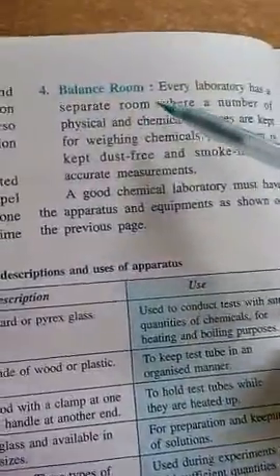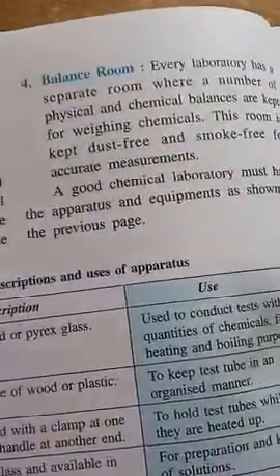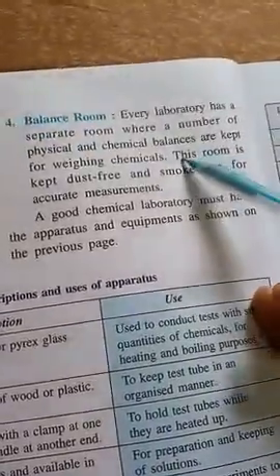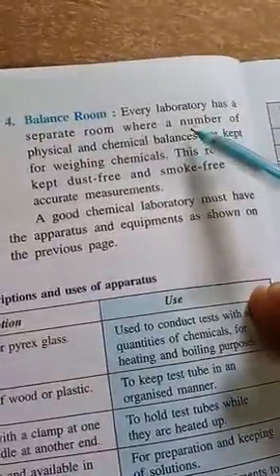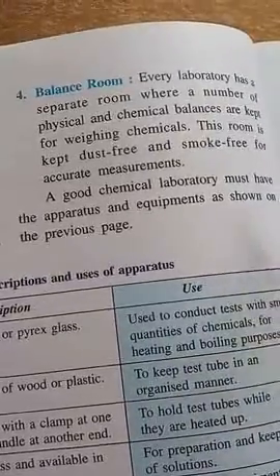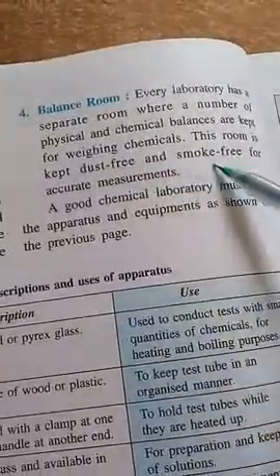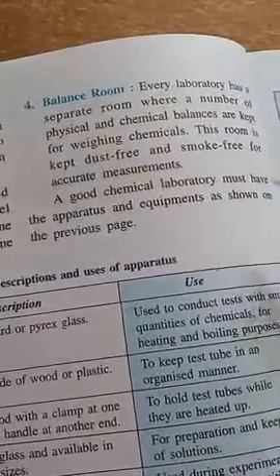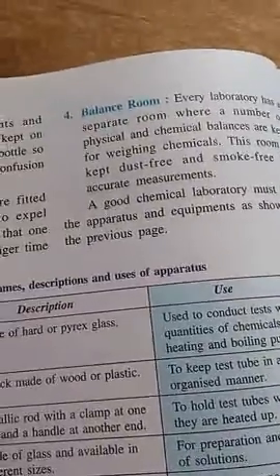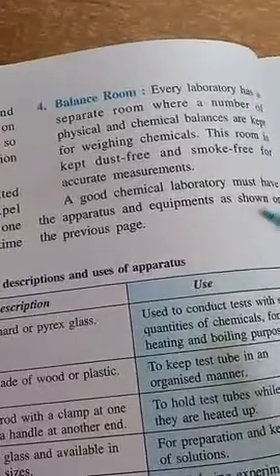The balance room is a room where different types of chemical balances are kept for weighing chemicals. Each laboratory has a separate room where a number of physical and chemical balances are kept. It should be dust-free and smoke-free for accurate measurement. A good chemical laboratory must have the proper apparatus and equipment.